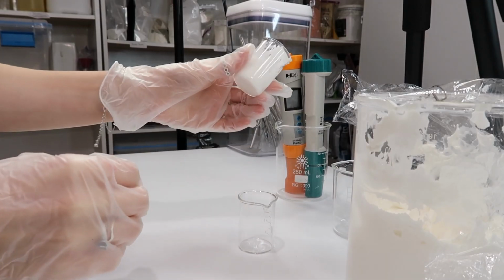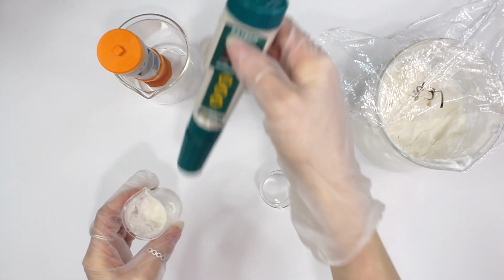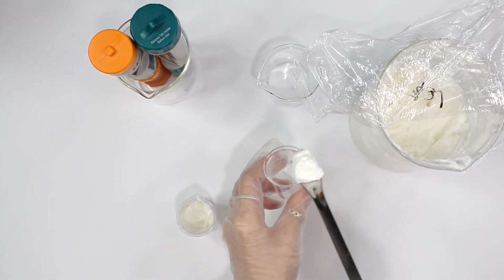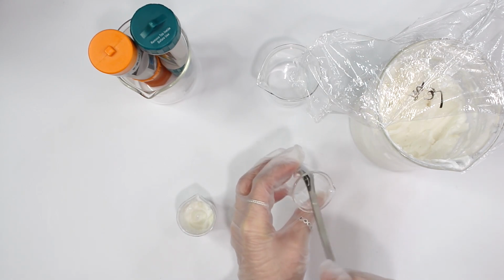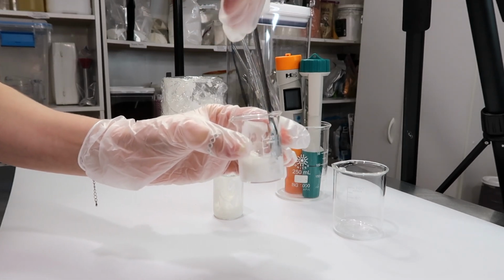So in this beaker here, I have some of my moisturizer, and I'm gonna be using the pH meter that can measure thick creams for this one. And then over here, I'm going to dilute 10% of the cream in distilled water. So that means you need at least 1 gram of cream to 9 grams of distilled water. So put your cream in your beaker, add in some distilled water, and then you just want to mix the cream in until it has dissolved in the water.